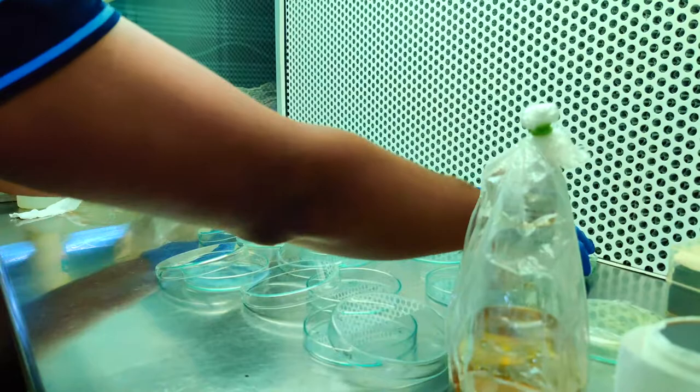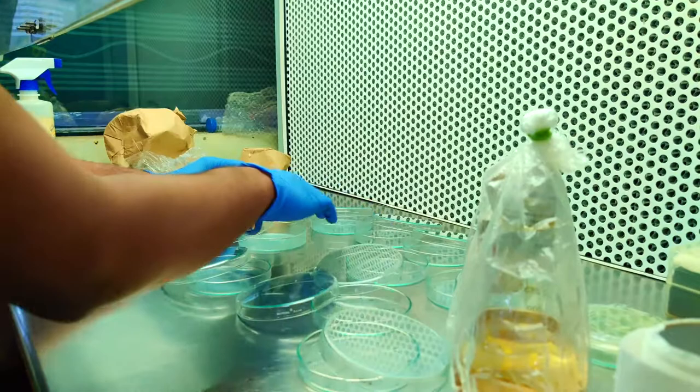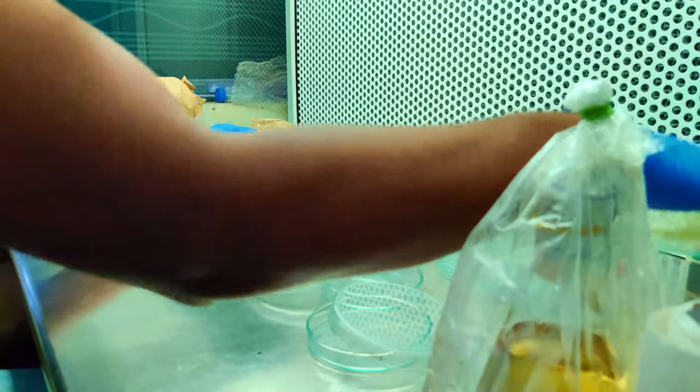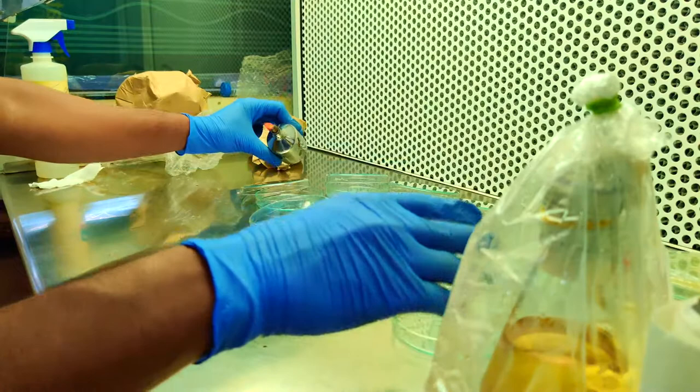After properly placing, we should mix the agar solution so that the agar which got settled under will be properly dissolved from topmost layer to the bottom.